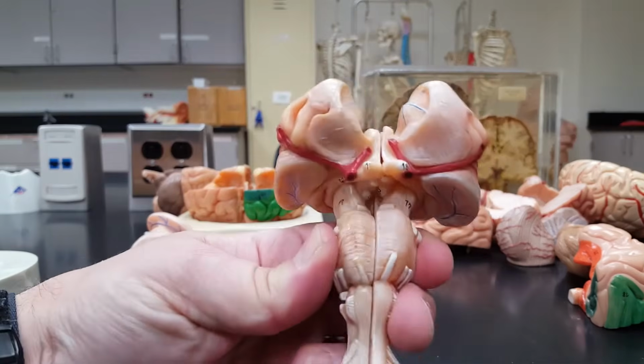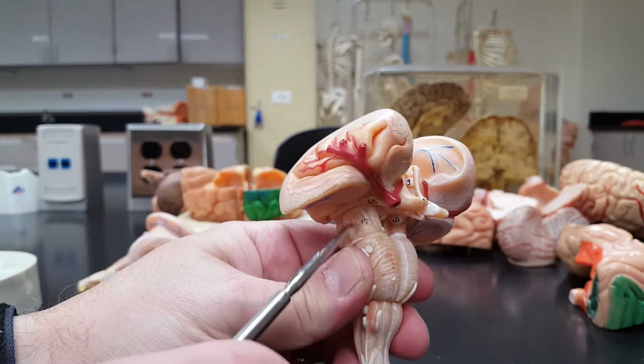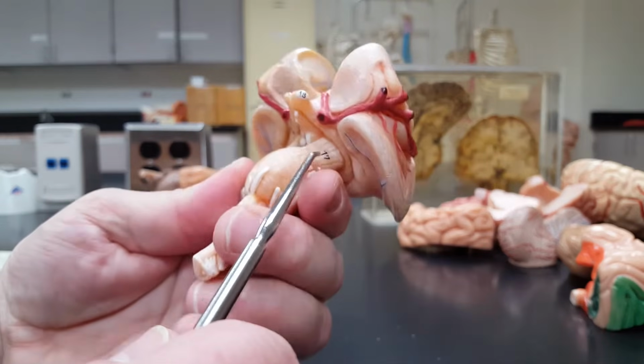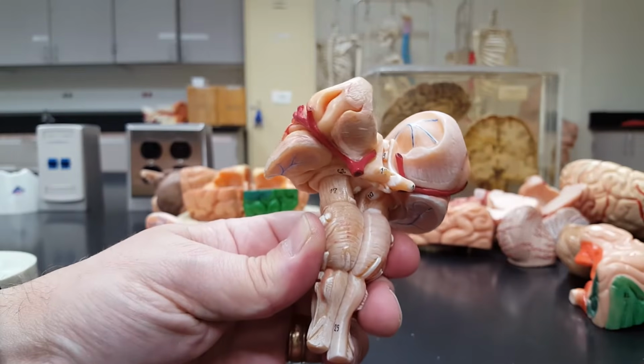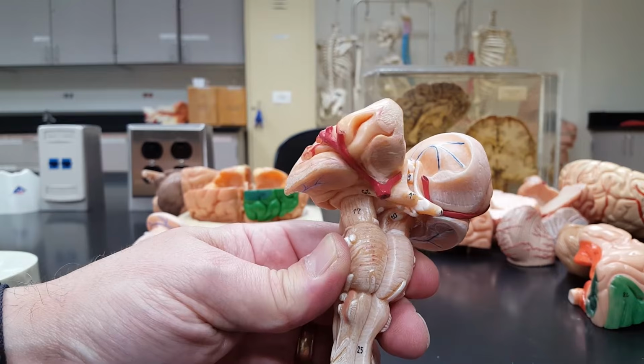Look for those in the right-hand column. Cerebral peduncles, that's the weird word, peduncles, connecting the pons and the cerebrum. I have another brain stem right here. So notice everybody, the pons, and what's this? Cerebral peduncle. Again, sorry, but I have to jump back and forth between the right and left columns here for us to get some of these things.